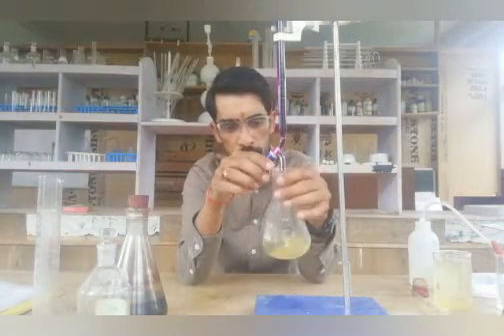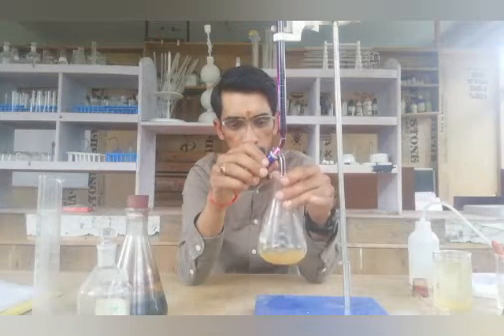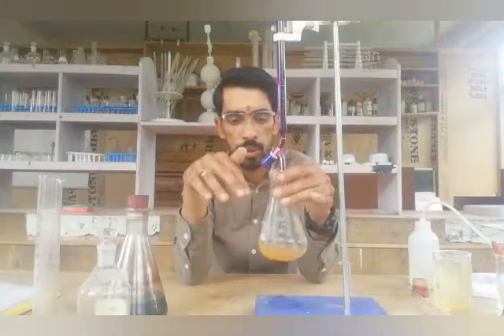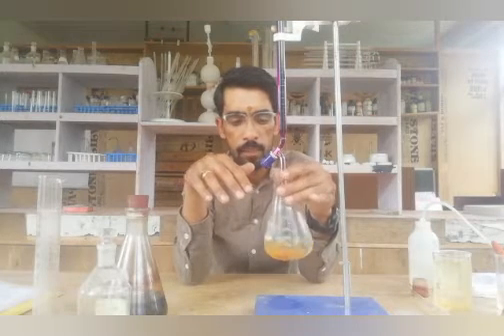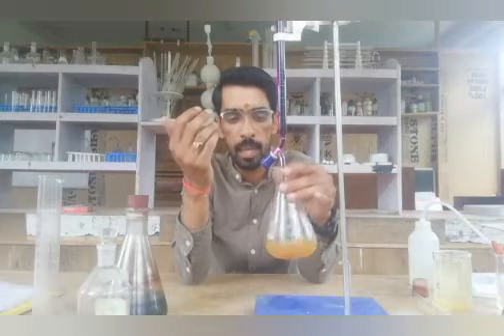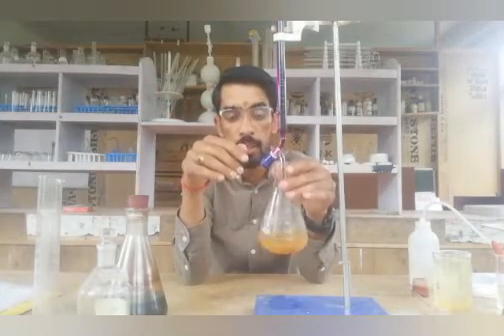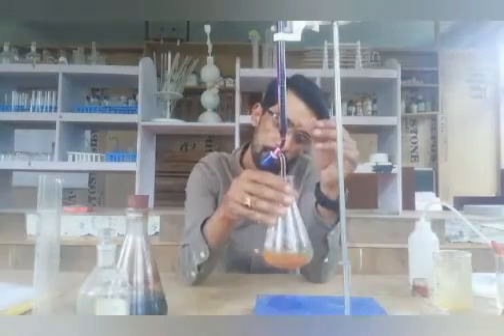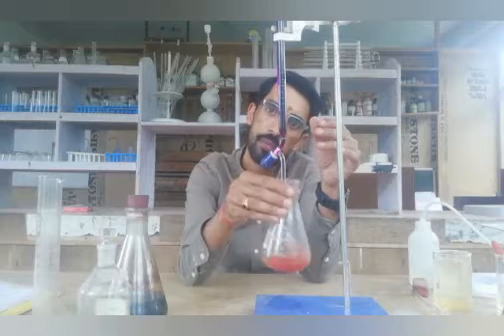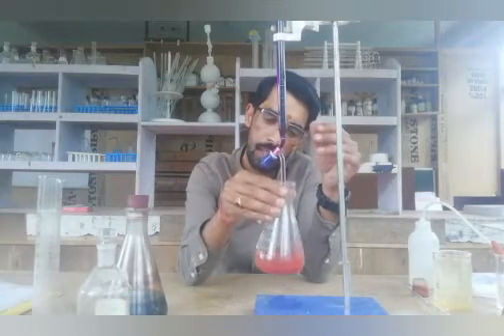The moment the solution changes into pink, we reach the end point — that is our first reading. Run the solution slowly, gradually — it should not be very fast. Your eye should be on the flask while your hand controls the burette. We are about to reach the pink point. You can see the colour changing slowly into pink. The moment we reach that point, we stop the solution — that is our end point.